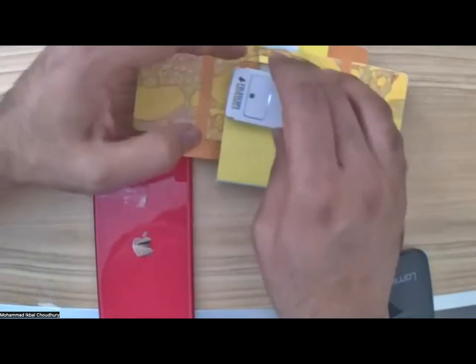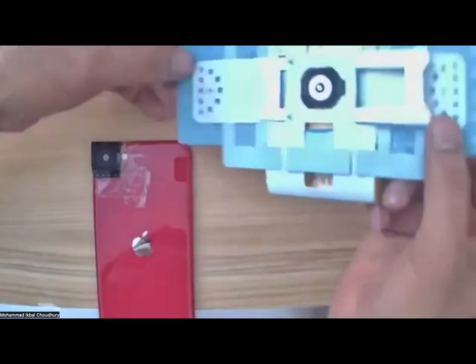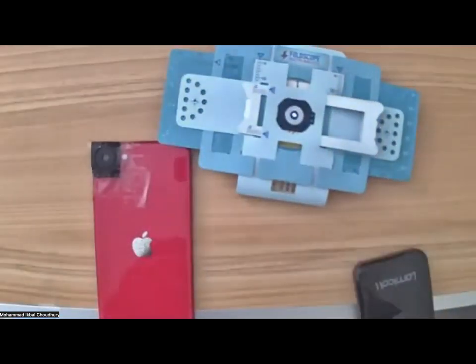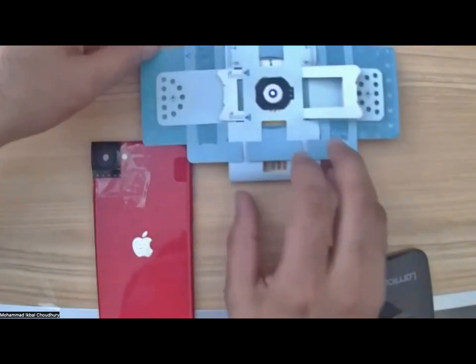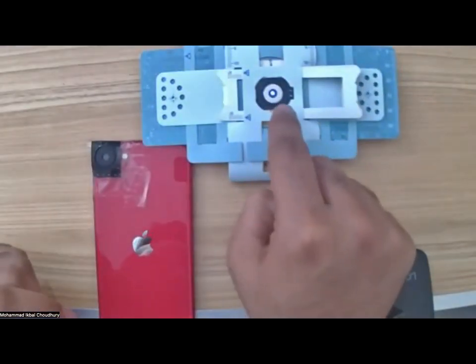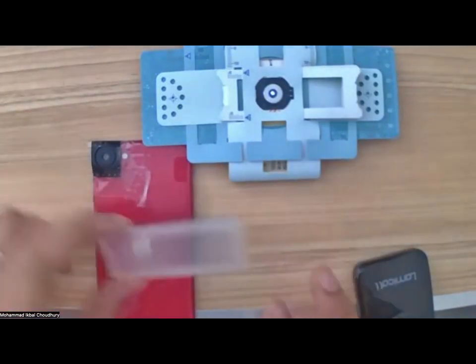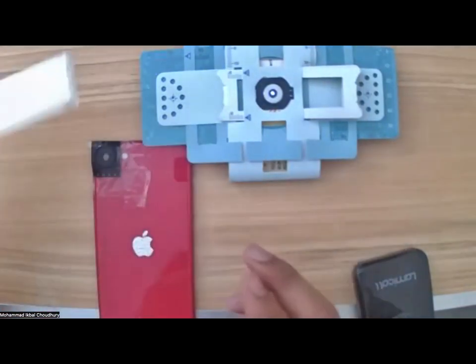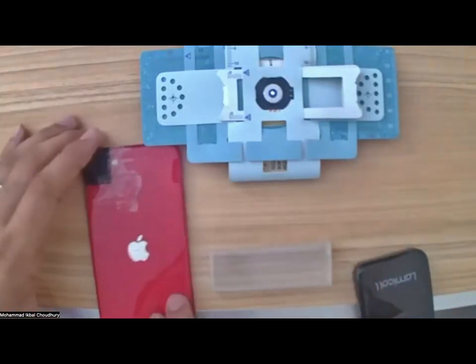Not so sure whether it will stay more bright, but that's okay. Now I will place it like that, right? So let me see if I can place it. So you can see the light coming out through the lens. And just to balance your cell phone, I usually use this box, which basically had the slides in. So I leave it like that.